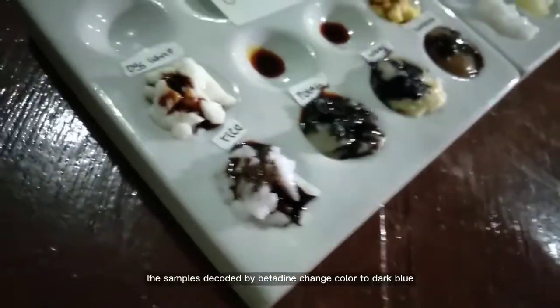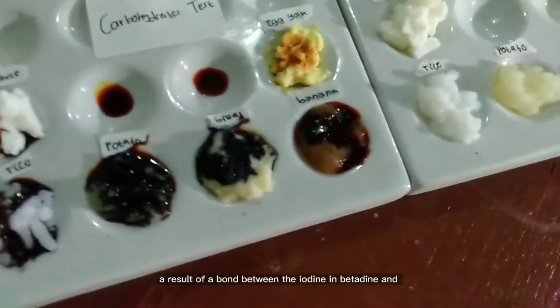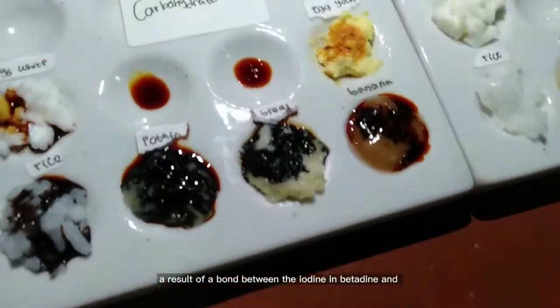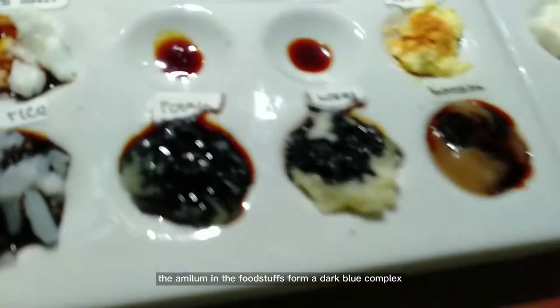The samples dripped with betadine changed color to dark blue, a result of a bond between the iodine in betadine and the amylose in the foodstuffs forming a dark blue complex.